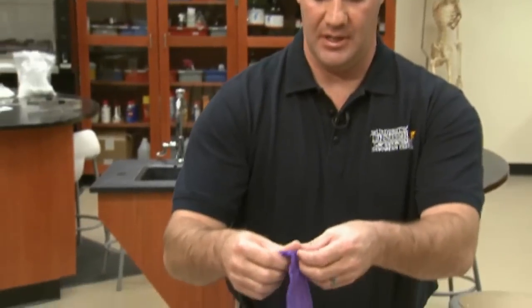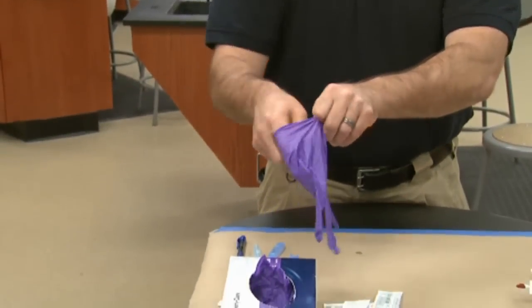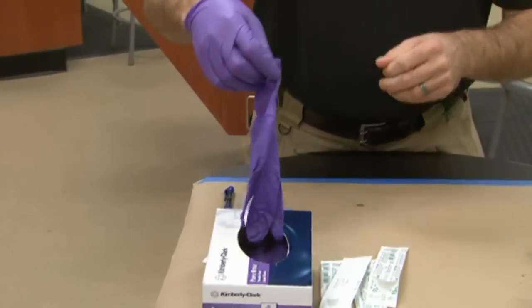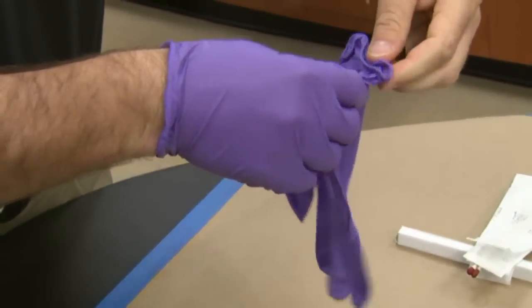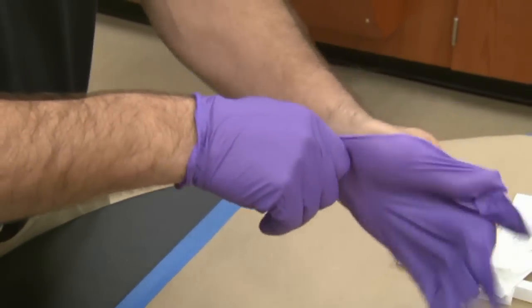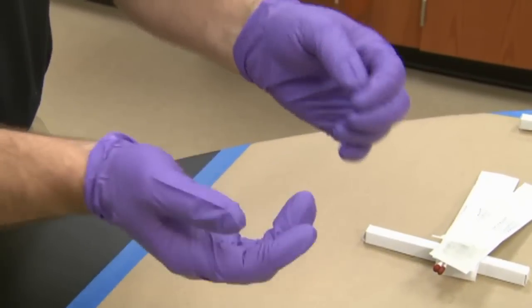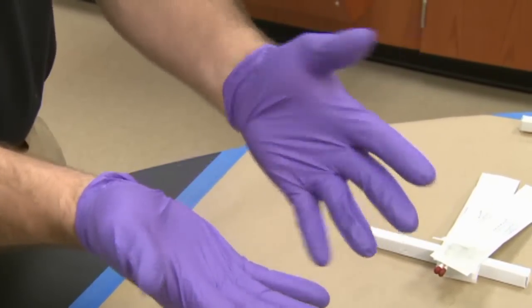Given consideration to touch DNA, which is a very sensitive DNA testing, when you grab gloves out of the box, you should always try to grab the base end as opposed to the fingertips and avoid touching those if possible. So you grab from the bottom end of the glove and put them on. That hopefully avoids getting your DNA on the fingertip portion of the glove that you're going to be touching evidence with.